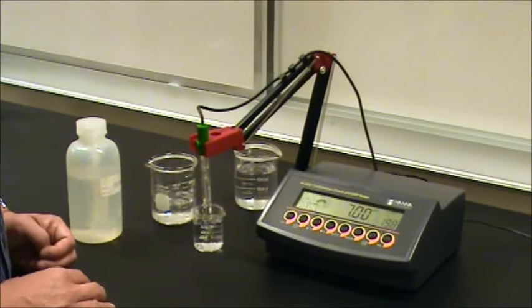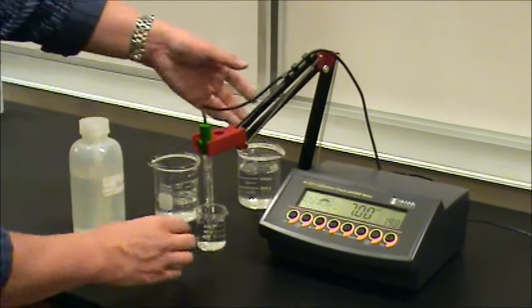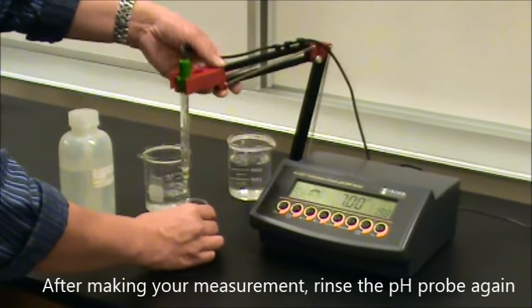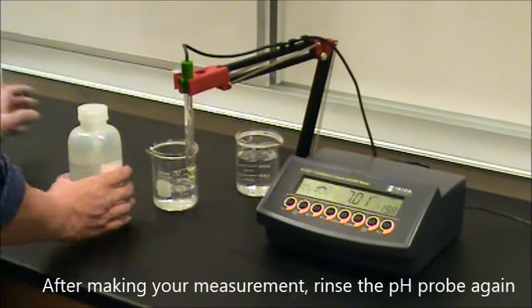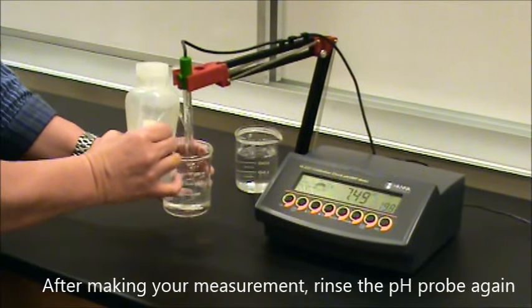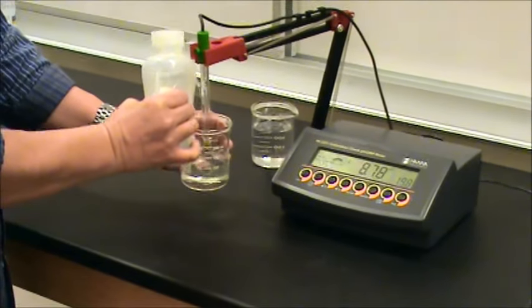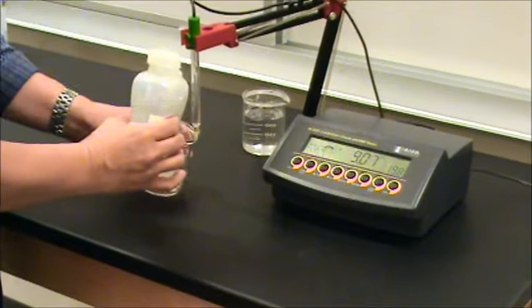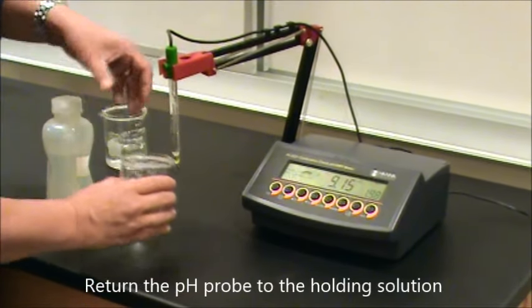When you're finished, take the solution that you're measuring away and rinse your probe again. Make sure it's rinsed really nicely. Once it's rinsed off and clean, then put it back into the holding solution.